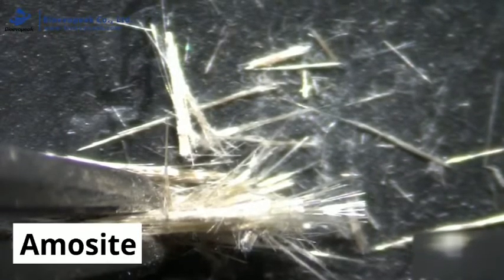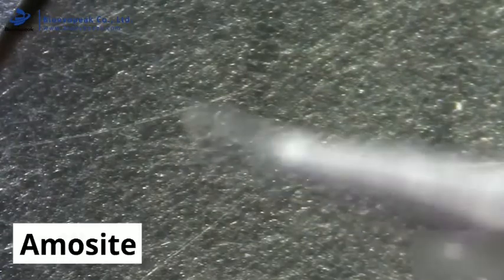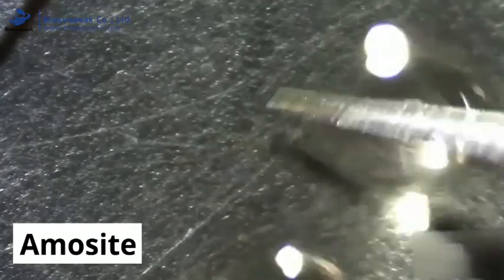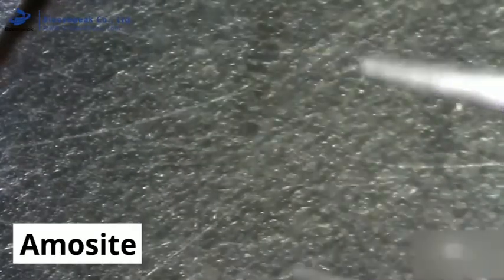These fibres are mounted onto a microscope slide in an oil which shares similar optical properties to that of the suspected asbestos type. This is then assessed under the polarized light microscope by rotating the fibre and changing the settings. This first test searches for pleochroism and relief and would present as a change in colour or the fibre standing out significantly against the background.